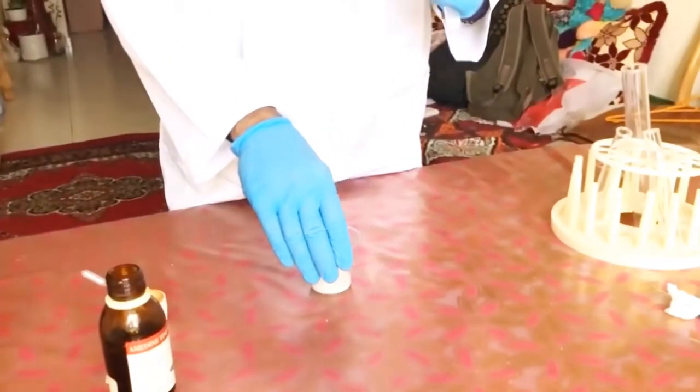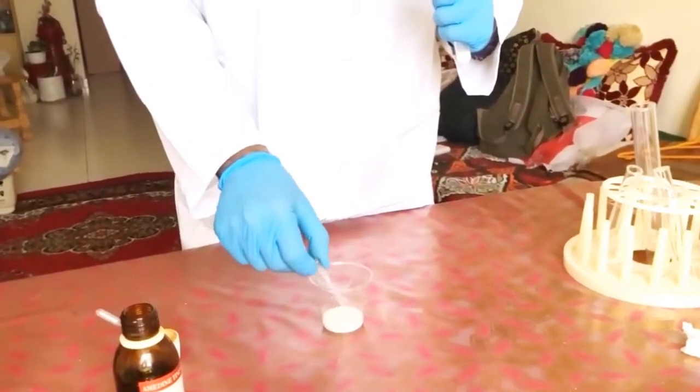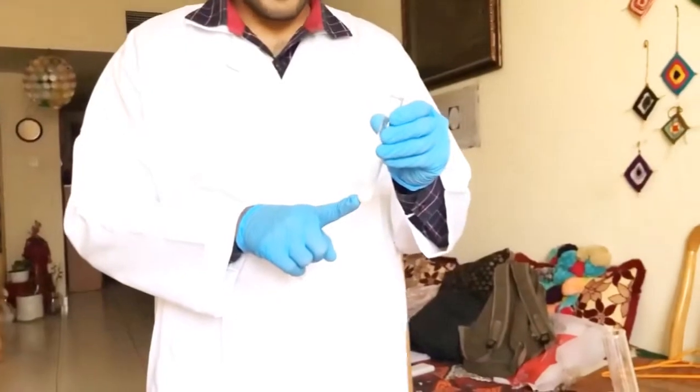We have taken the starch powder for the first test which is the starch test. Mix it with distilled water, taken around 2 ml, and put in our test tube.